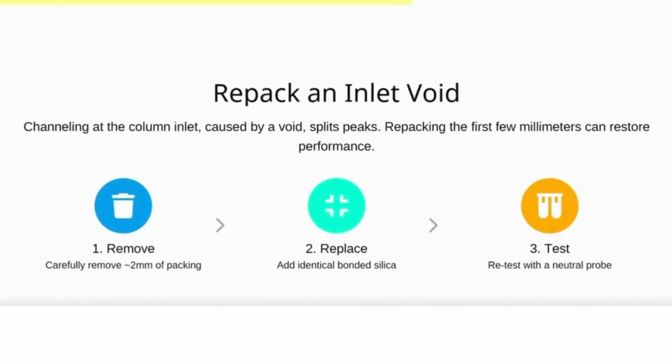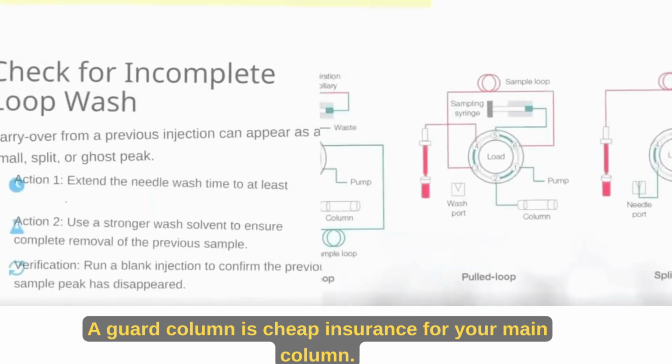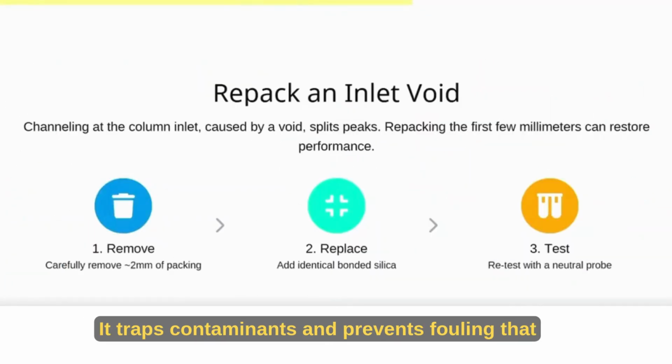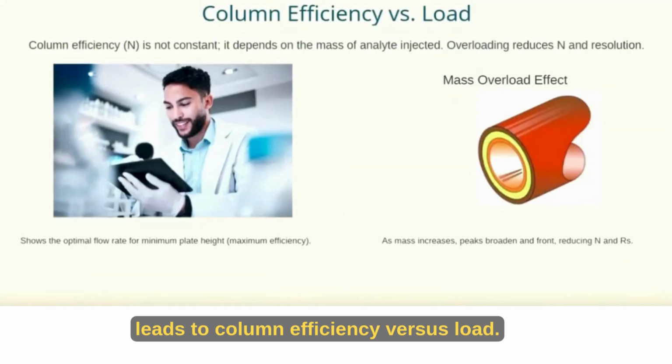Repack an inlet void. If you see channeling at the column inlet, it's time to repack. Removing just a few millimeters of packing and replacing it with fresh silica can work wonders. After retesting, you should see consistent, unified peaks again.